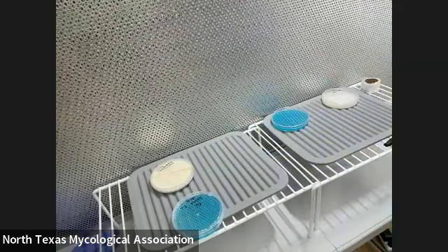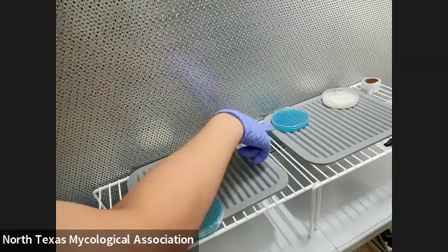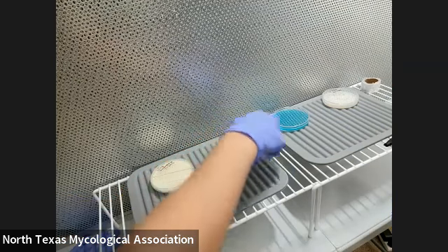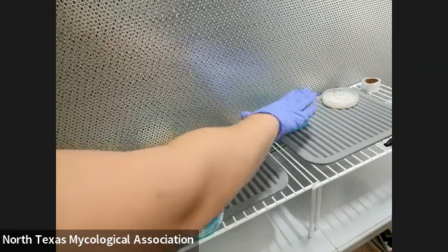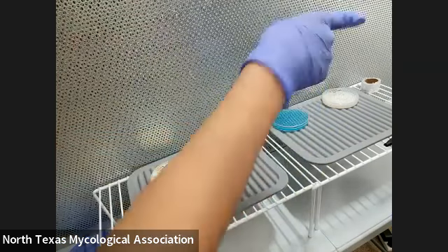The main thing is to not put anything dirty over anything sterile. Something sterile is inside this agar plate. So when it's open, you don't want your fingers or your arm or anything over it — only the scalpel that's sterile should go over the plate.